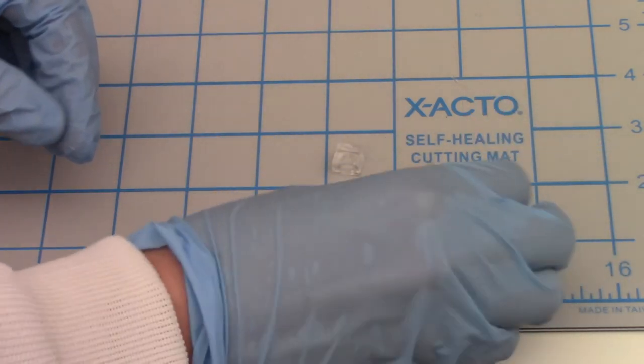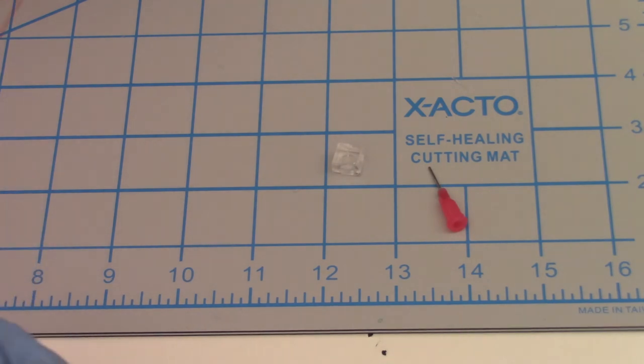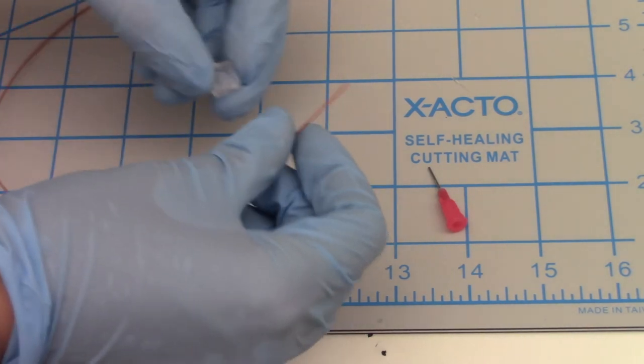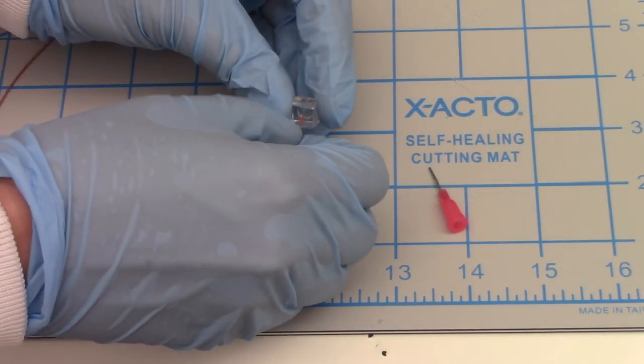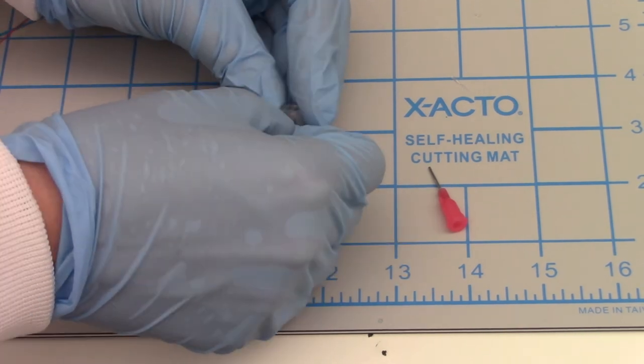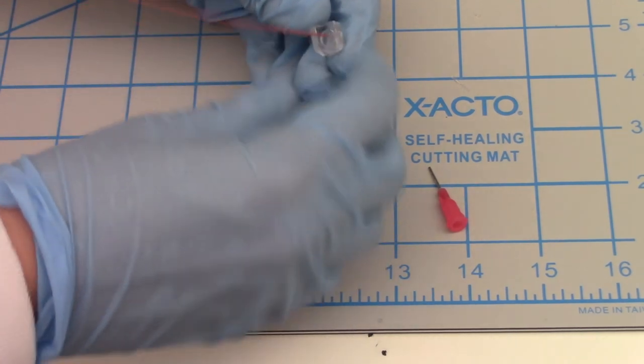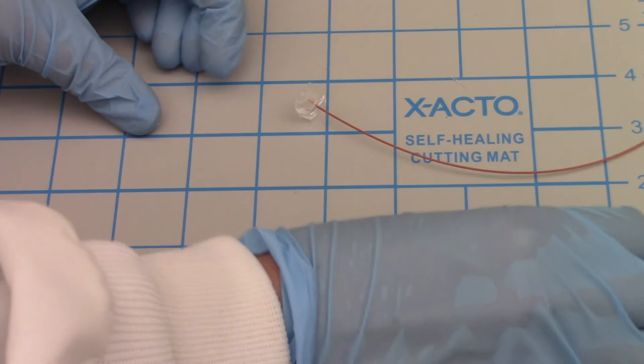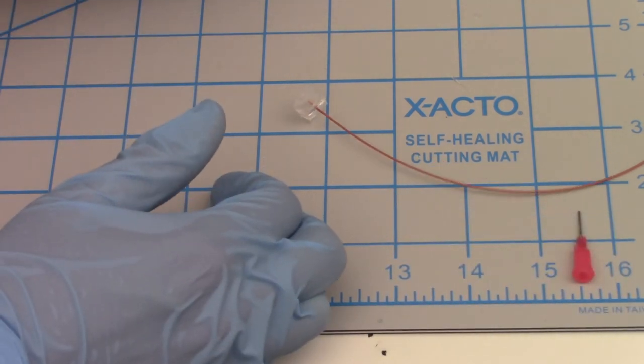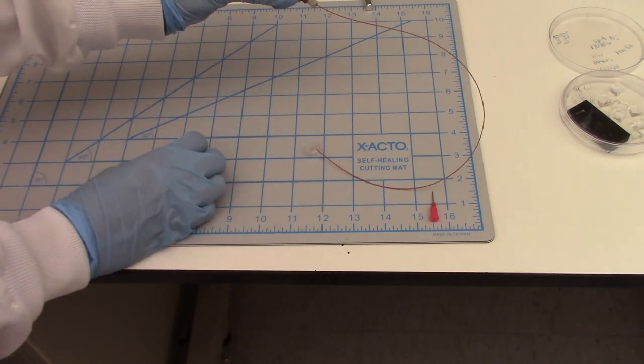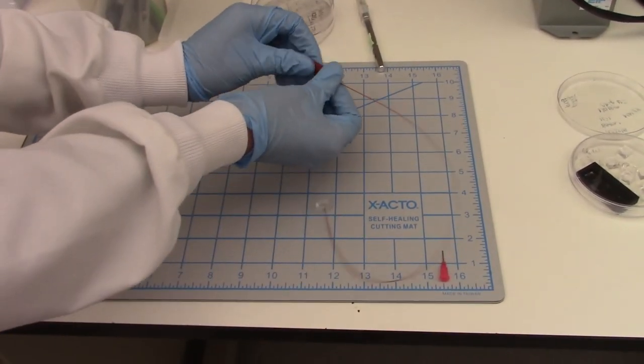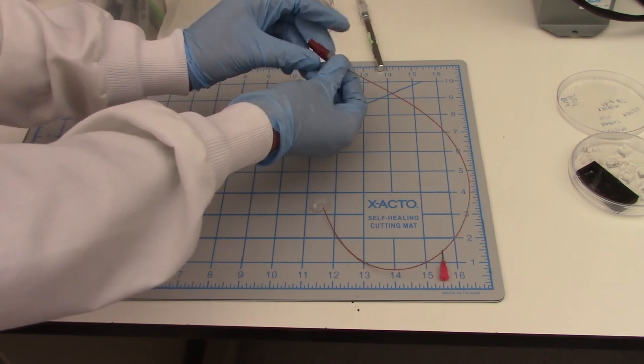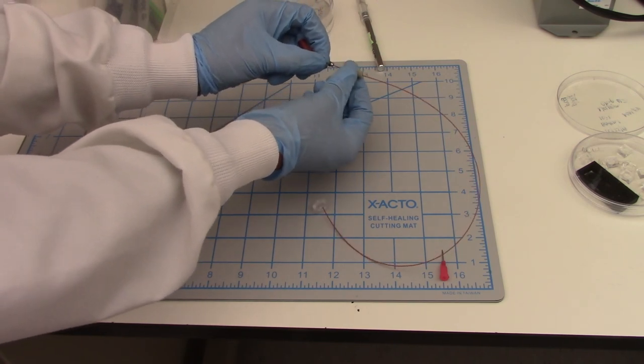Which is sized based on the size of our needle to be compatible with this orange PEEK tubing. So I'll show how this tubing fits into the hole before I show our adapter. So based on the size of our needle, this will actually hold the PEEK tubing in place with the compression fitting. And now on the other end of that, we need to think about how we're going to connect to a syringe. So this is an adapter that interfaces with the Luer lock syringe. So we have this red piece that actually attaches directly to the syringe. And then it attaches to this tan screw.